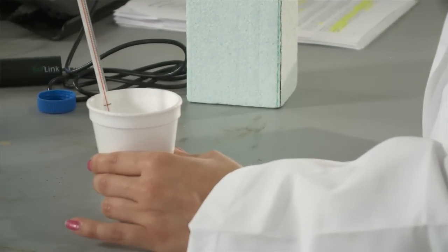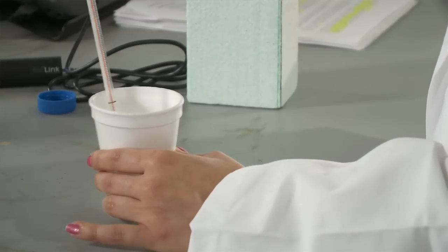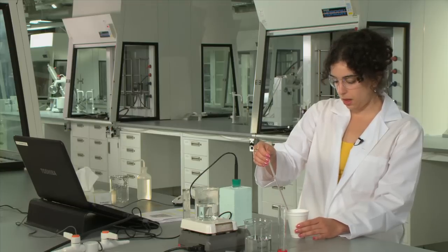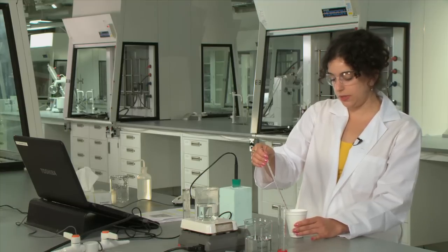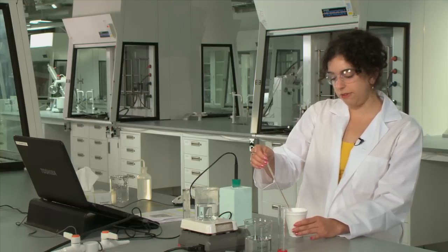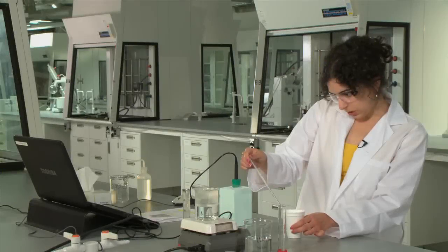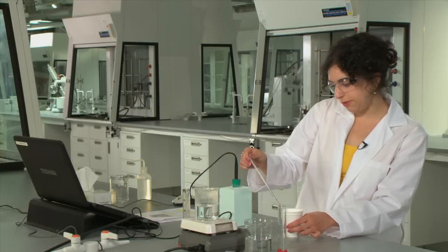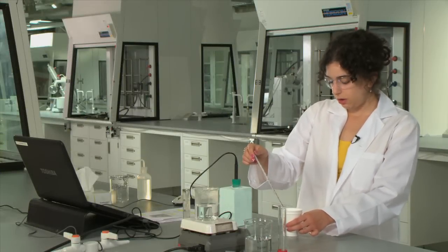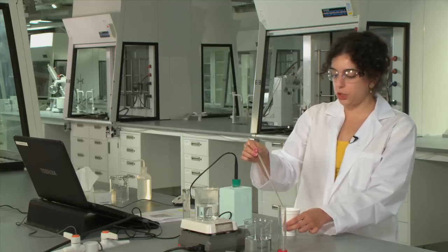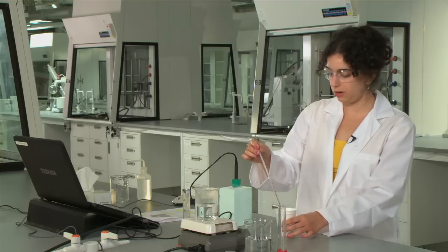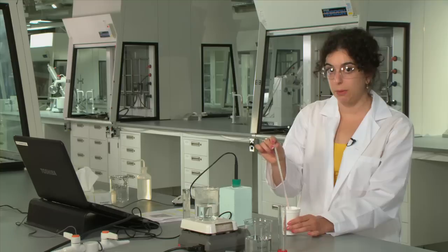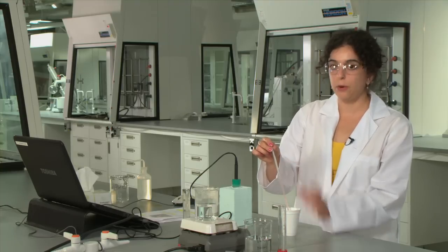So we'll let this stir for about a minute and we basically want to wait to see when the temperature becomes more or less stable and this is usually around 50 or 55 degrees so we're hovering at around 56 which is probably as good as we'll get it. Make sure that you record this temperature because you won't pick it up on the Logger Pro software. This corresponds to your initial temperature of your hot water.